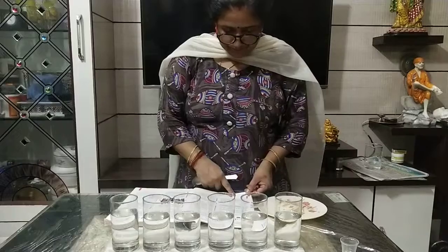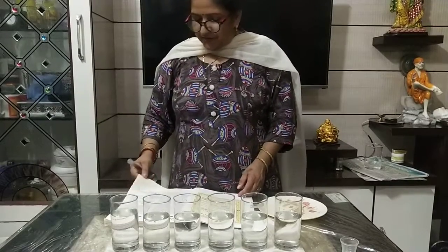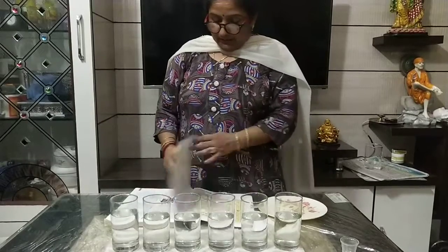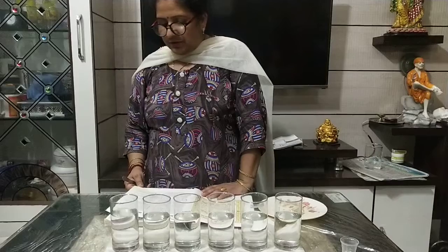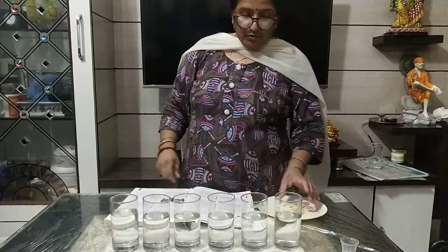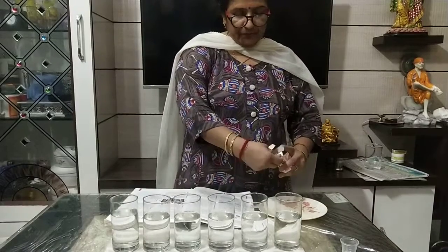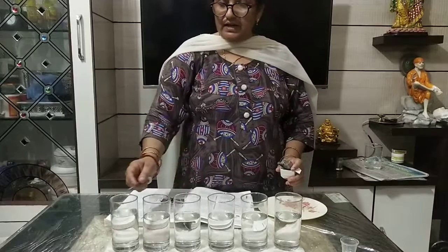Dear friends, open page number one. Chemistry — how small are the particles of matter? I am showing you with the help of potassium permanganate. Look here, I am having six glasses.